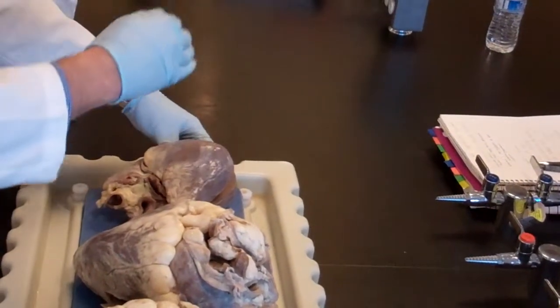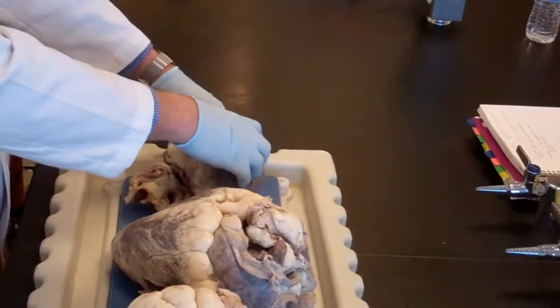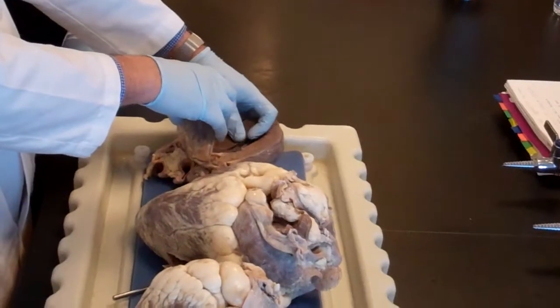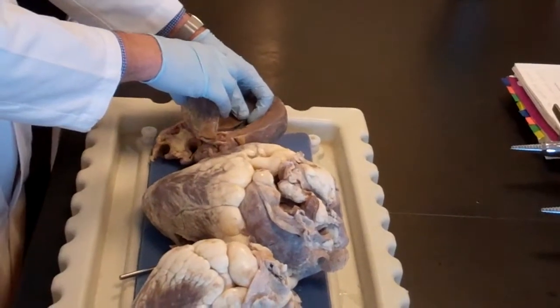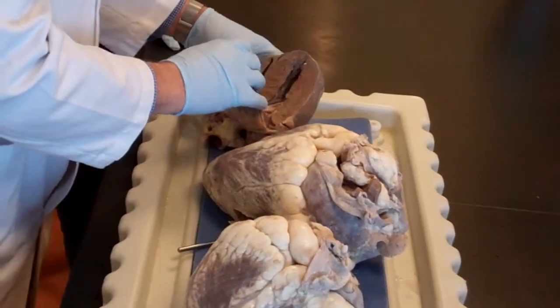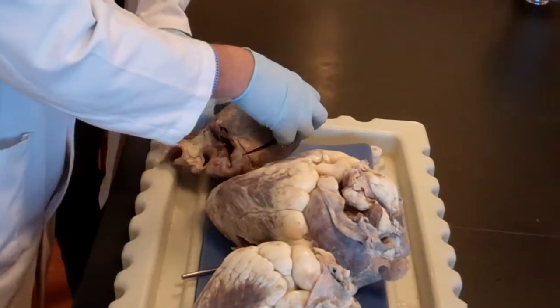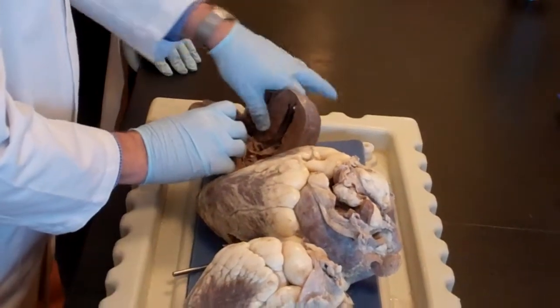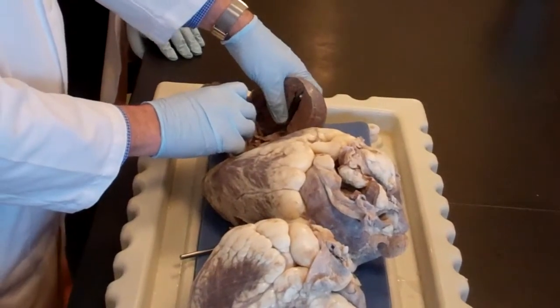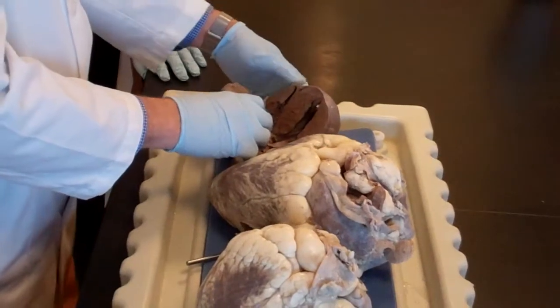And those little bumps, ups and downs, like little mountains and valleys, these are called the trabeculae carneae. So technically these are meat columns. Okay? That's the translation of it, right? With layman's term. And that's the interventricular septum right here. To confirm that the interventricular septum, the landmark of it is what? The anterior interventricular sulcus. Make sense?